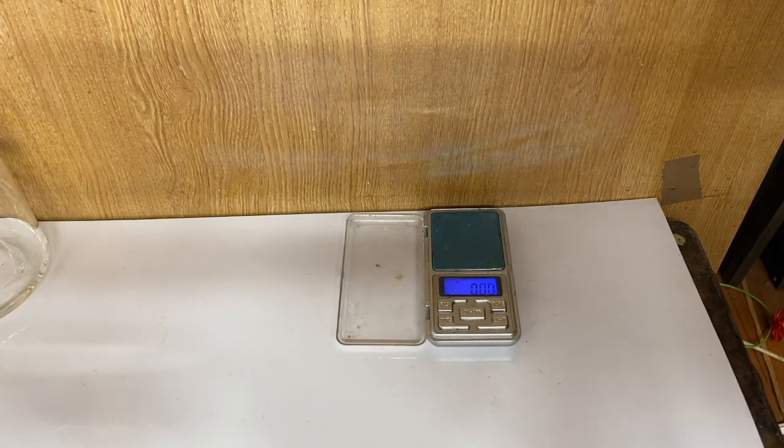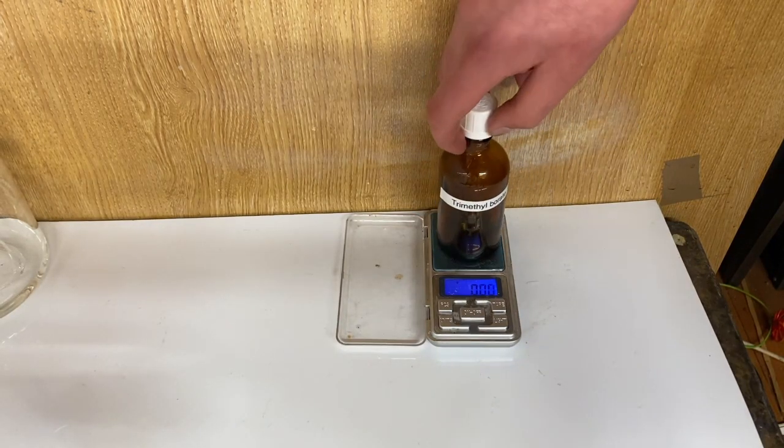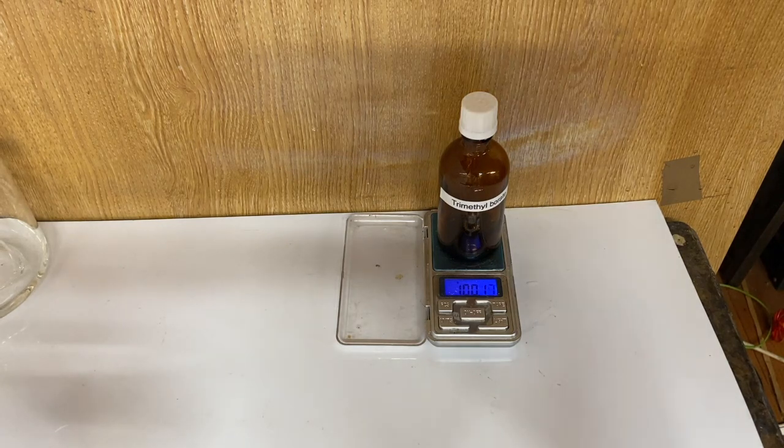I'll now work out how much trimethyl borate I have made and what my yield is. First, I weighed out the empty bottle.